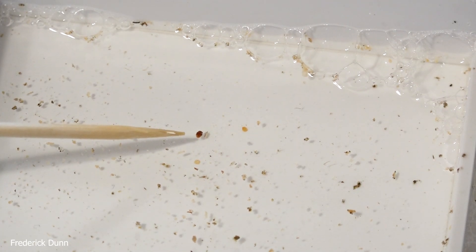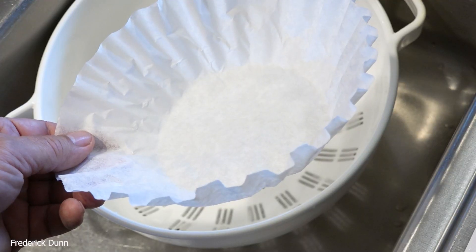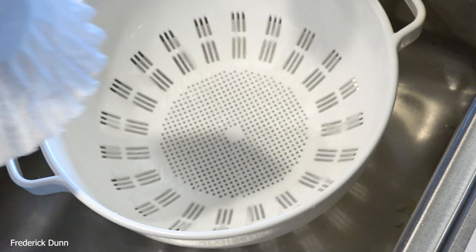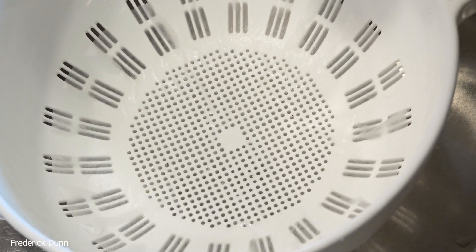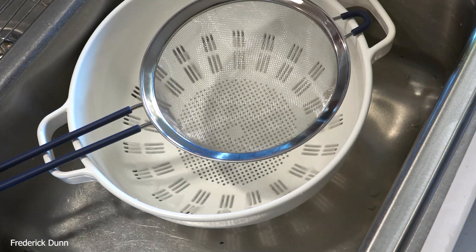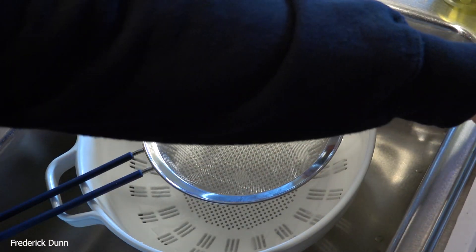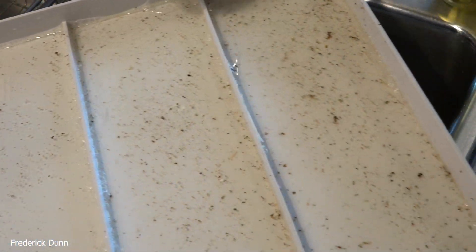Here they are. I pre-washed in the bottom here with some Dawn soap, and I'm using paper coffee filters. The procedure is identical to what we did yesterday. People questioned whether or not this sieve — this screen — was too fine to allow mites to go through, so I thought the best way to demonstrate that it works is to do it with a known mite source.